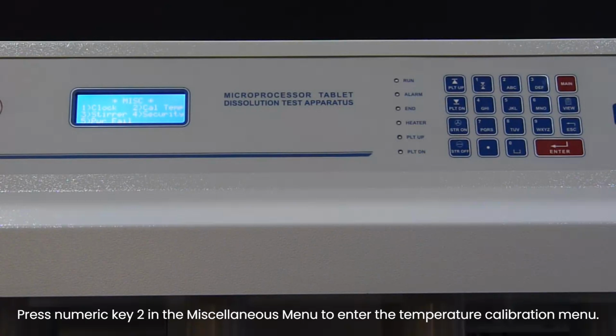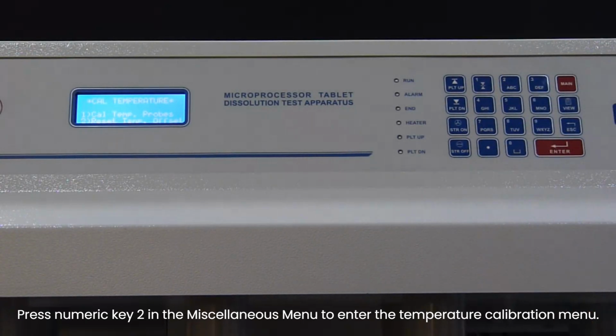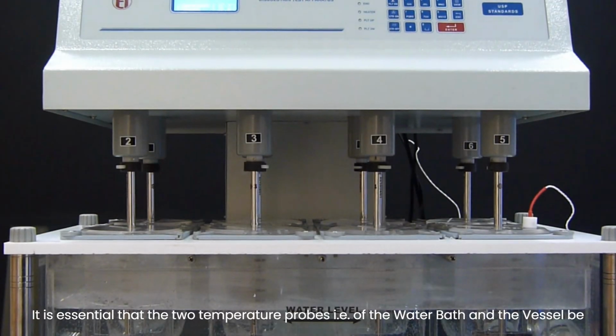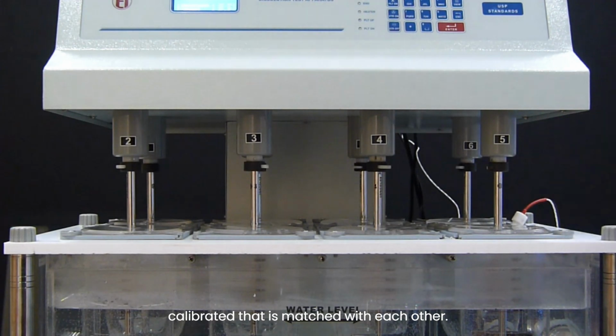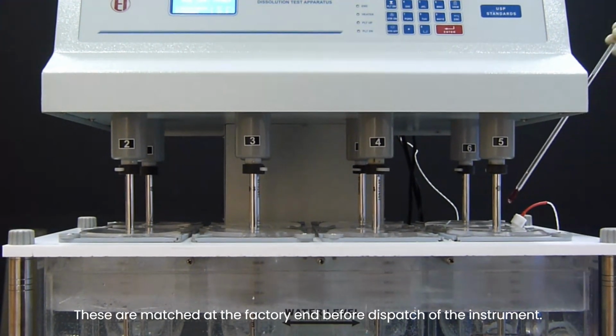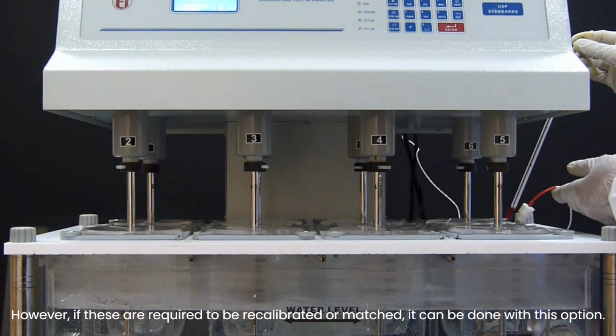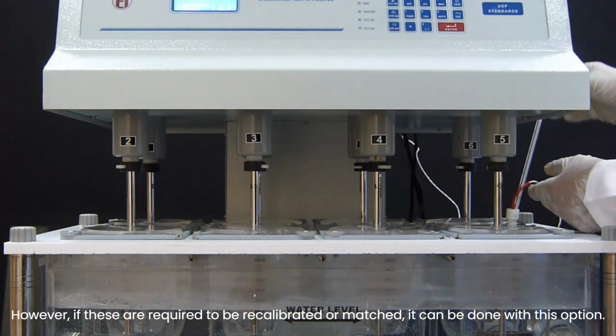Press numeric key 2 in the Miscellaneous menu to enter the temperature calibration menu. It is essential that the two temperature probes, that is of the water bath and the vessel, be calibrated, that is matched with each other. These are matched at the factory end before dispatch of the instrument. However, if these are required to be recalibrated or matched, it can be done with this option.